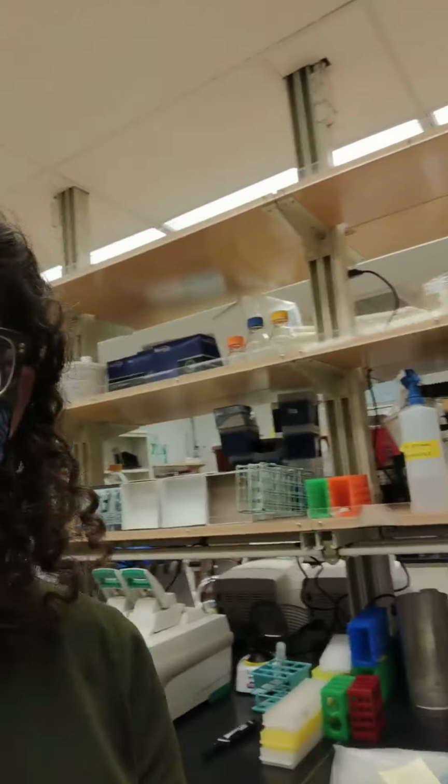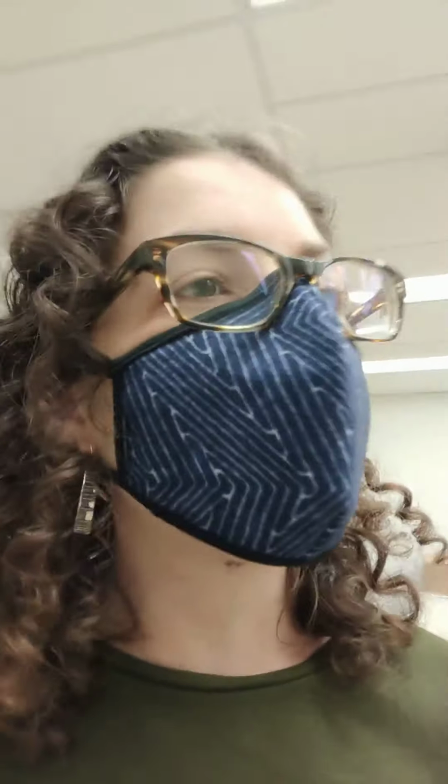One of the projects that we're working on was actually kickstarted by master's student in the lab, Jonathan Beutler. And this is his bench. Unfortunately, I cannot introduce you to him because it's a pandemic and we're working shifts. But Jonathan's work has been characterizing the virulence of 19 different strains of Ralstonia.